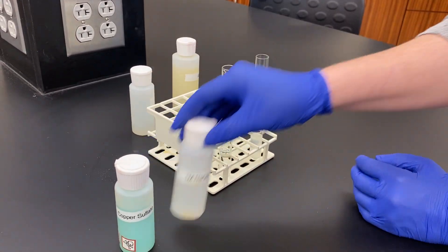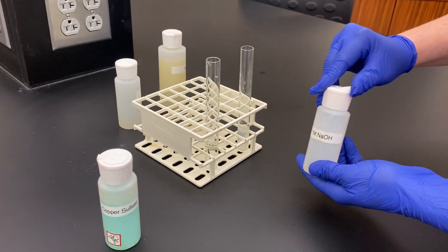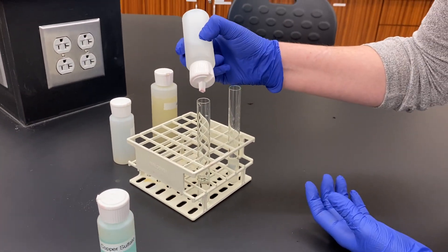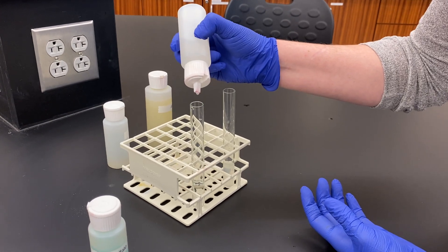What we're going to do is add 20 drops of each of these reagents. I'm going to add 20 drops of sodium hydroxide first. So this is a very strong base, a one molar solution.